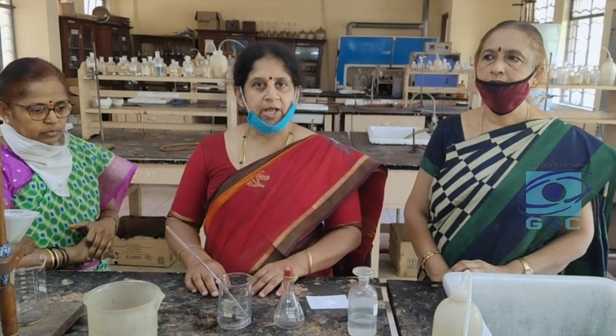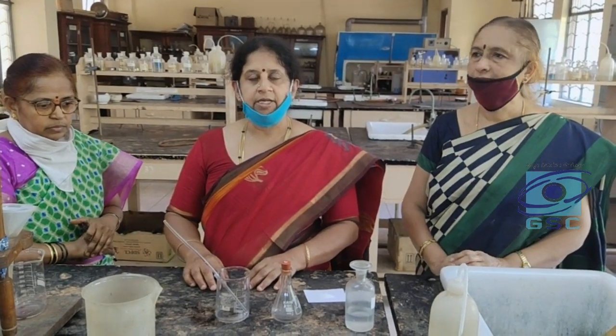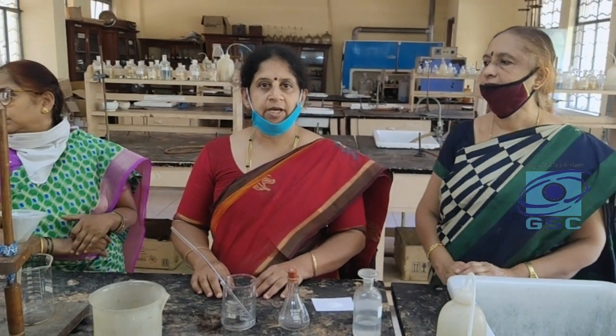Dear students, today I am going to show the preparation of hippuric acid, which is chemically known as benzoyl glycine. This is a very simple benzoylation preparation and it is a one-stage preparation. This is one of the experiments for 4th semester MSc Organic Chemistry.